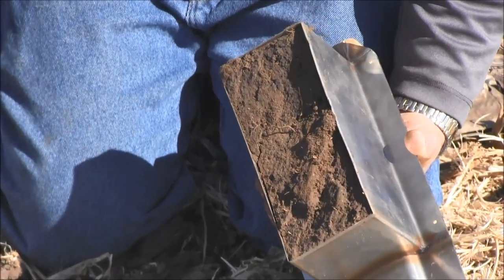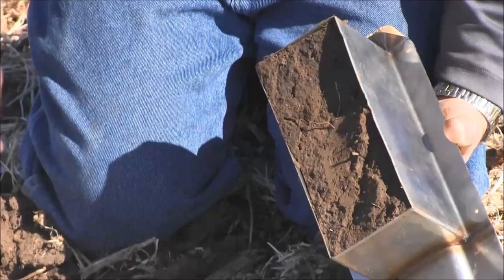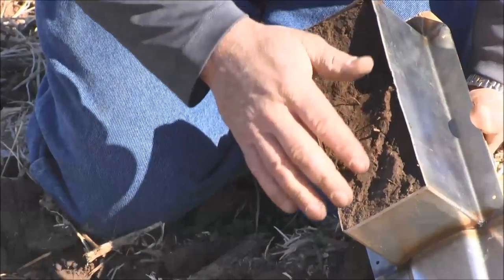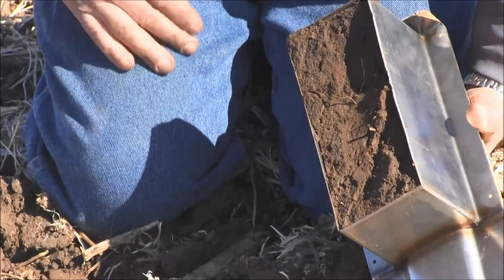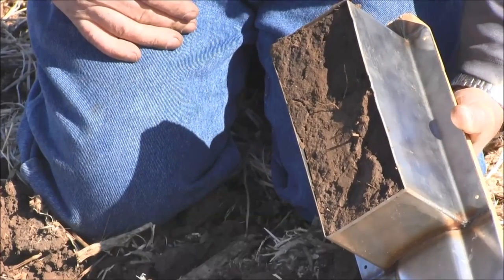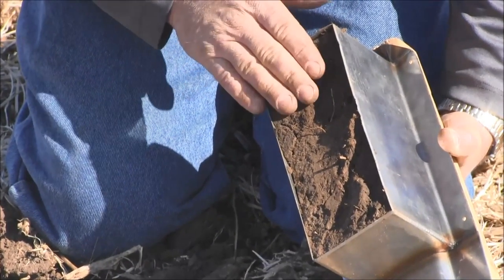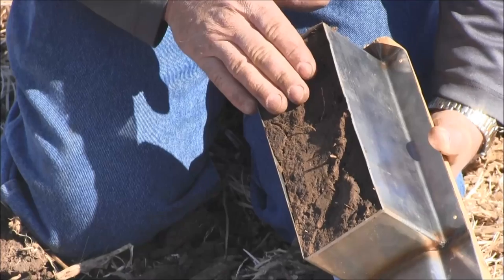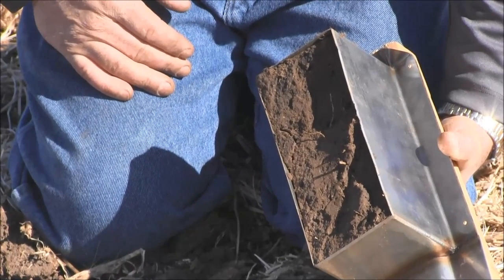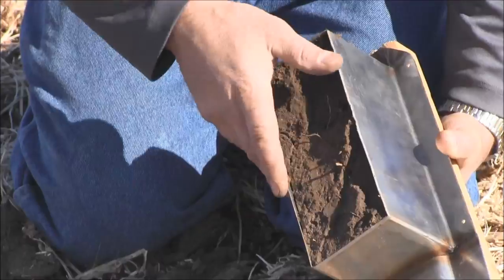We're going to uniformly shear that off. The interesting thing to me is that you can still see that we have some pretty good macropores through that platiness. It's still going to infiltrate fairly well for a no-till sample. But you'd like to see a lot better granular structure and a lot better soil development. That's an issue for this producer.